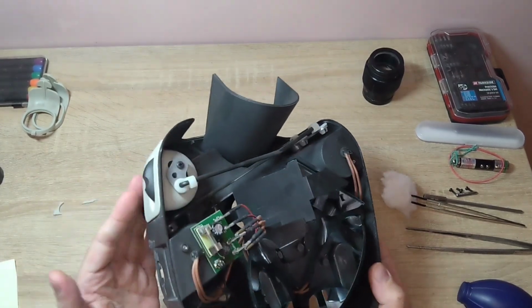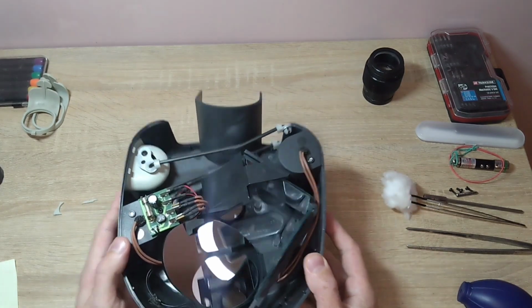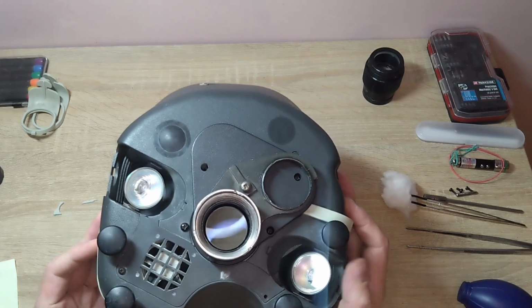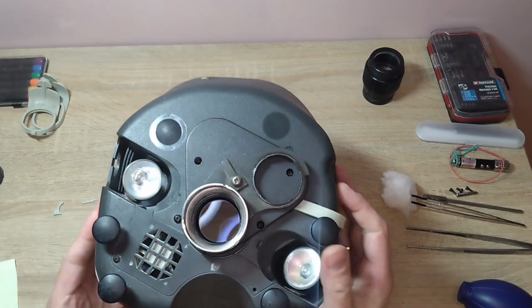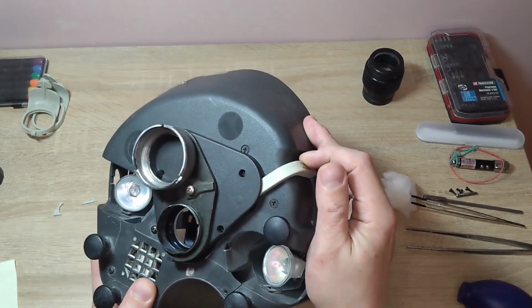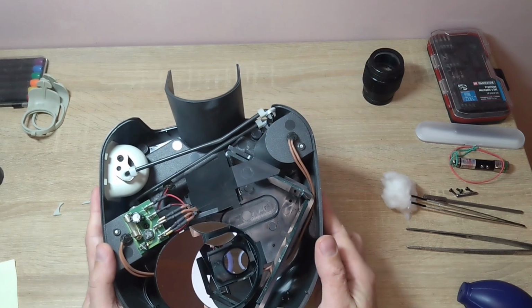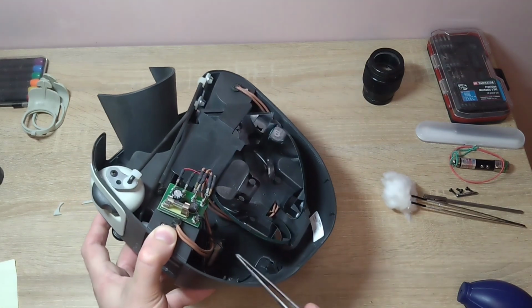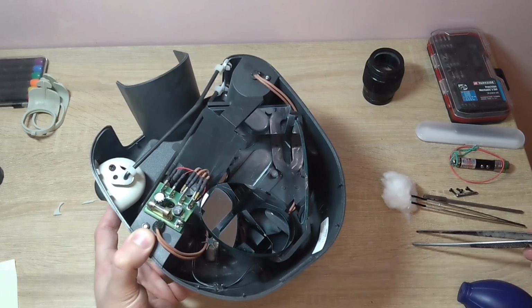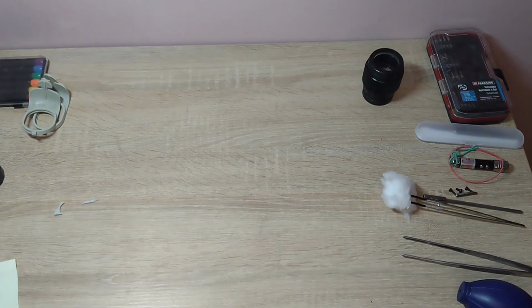There are also two projectors on this part of the microscope. Now, look, they just bend a little bit more. And there are two objectives of the revolving type. This is how the magnification changes. There is also a desiccator in this place. Well, I think this is a desiccator that removes moisture. I will set this part aside for now.